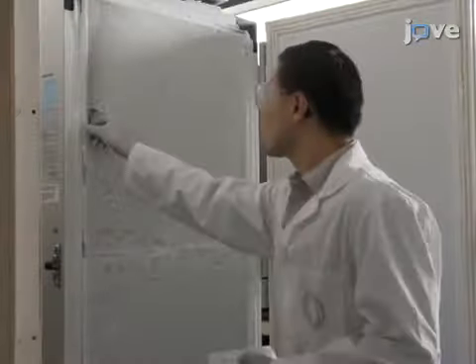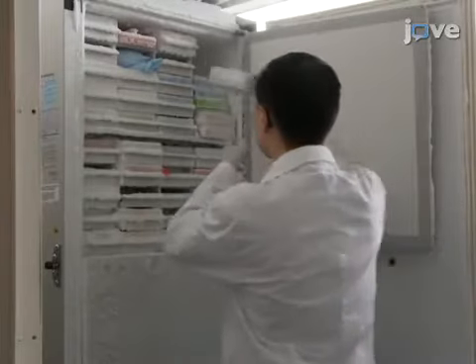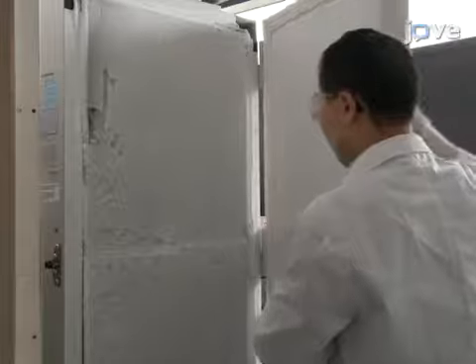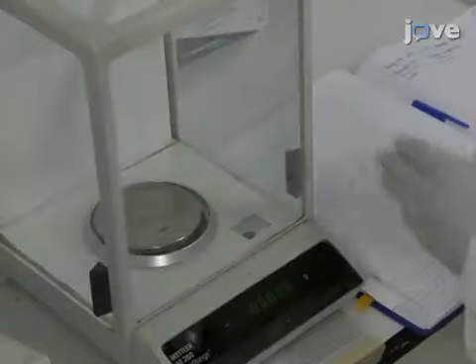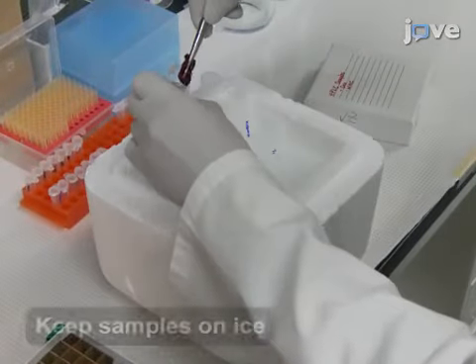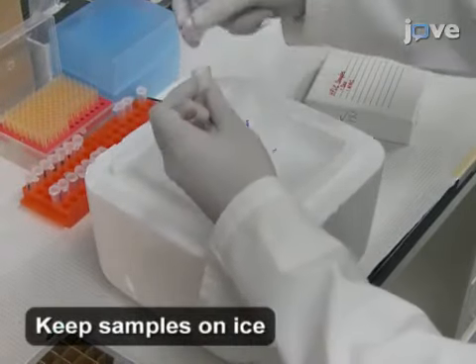To begin this procedure, collect and freeze the whole blood, major organs, and breast tumor as outlined in the text protocol. Quickly weigh the frozen tissues and record the weight in the lab notebook. Then, transfer them into a 13 milliliter round-bottom conical tube.